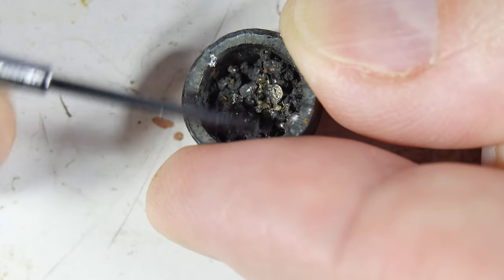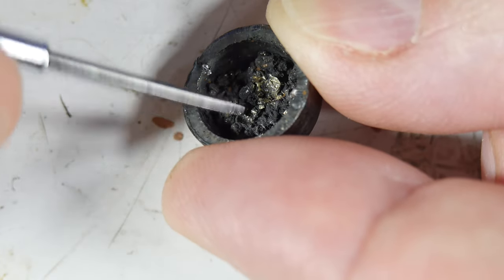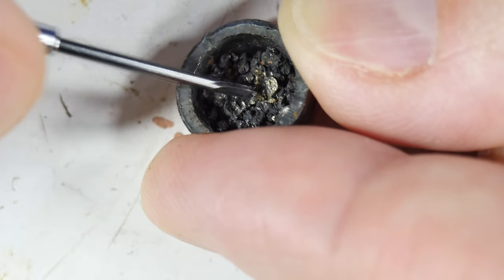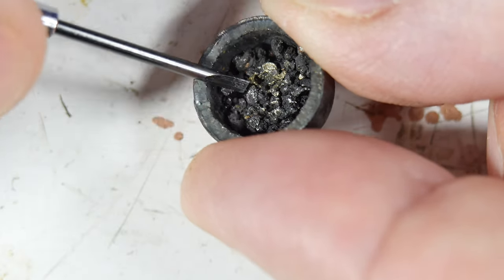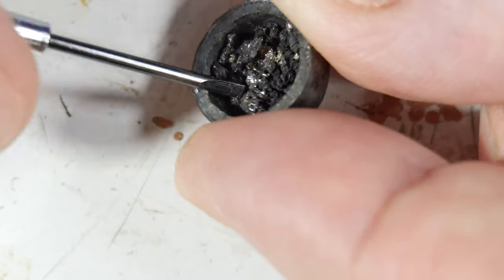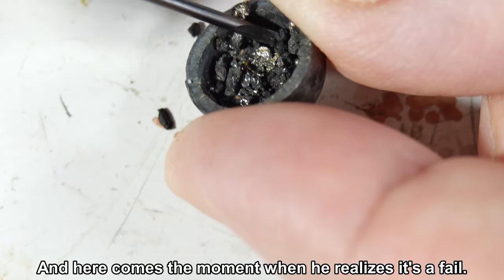But this black stuff needs to be removed because it's apparently just sulfur, and it's not galena, it's just like sulfur oxide. There we go, got a little bit more. So yeah, I just need to clean the sulfur off of here, and the chunks are breaking up.